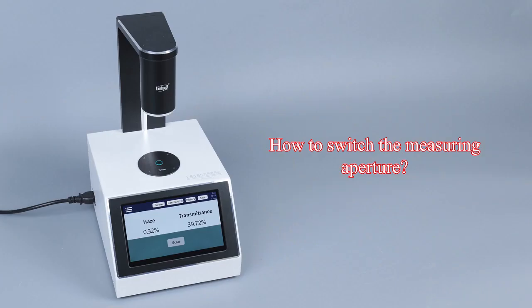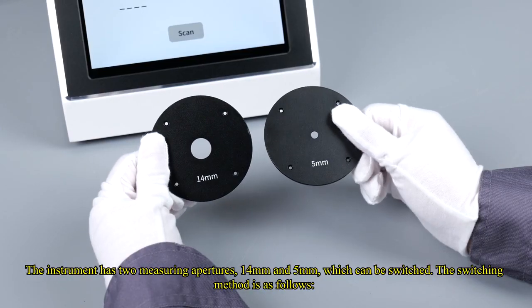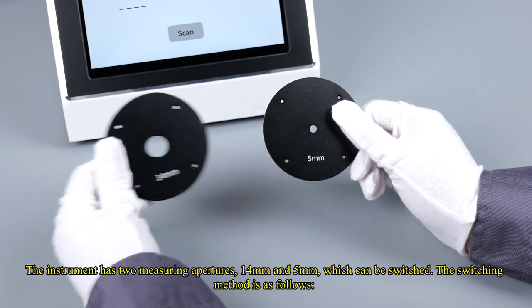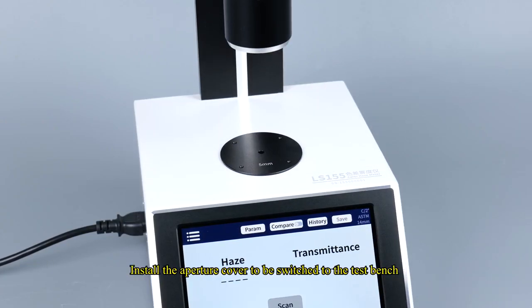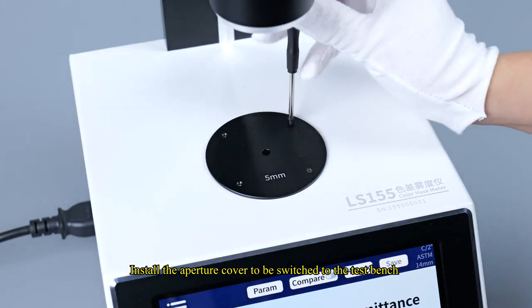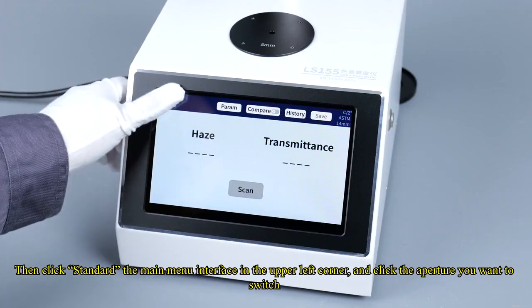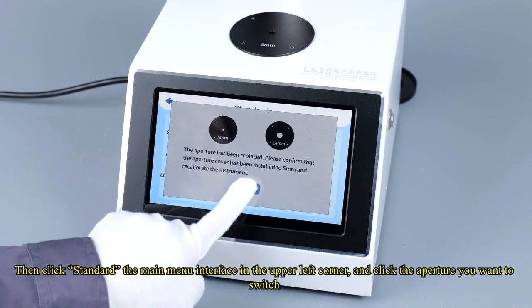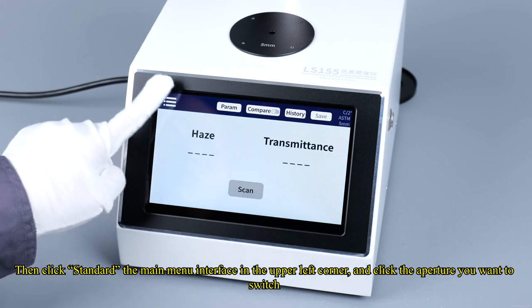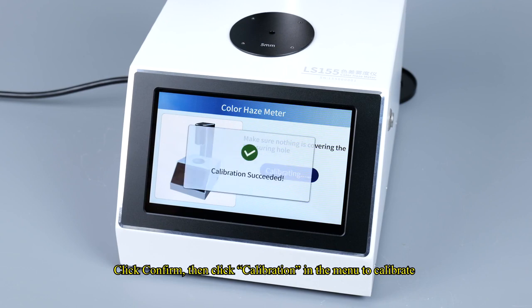How to switch the measuring aperture. The instrument has two measuring apertures, 14 mm and 5 mm, which can be switched. The switching method is as follows. Install the aperture cover to be switched to the test bench. Then click Standard in the main menu interface in the upper left corner, and click the aperture you want to switch. Click Confirm, then click Calibration in the menu to calibrate.